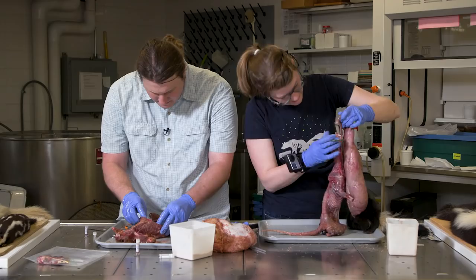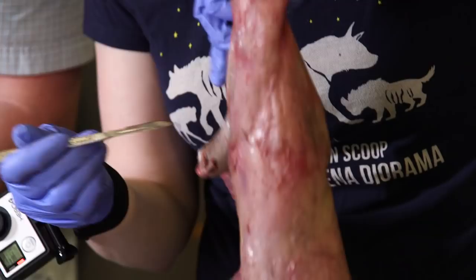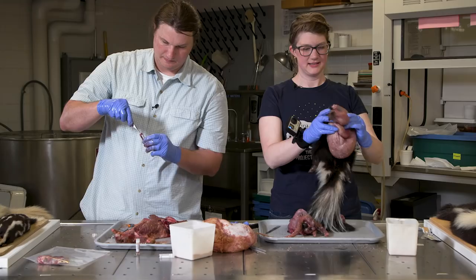Full of blood in her lungs and chest cavity. Why do you think that is? There are a lot of rodenticides — poisons that use anticoagulants. The smell of success — you can turn it inside out now.